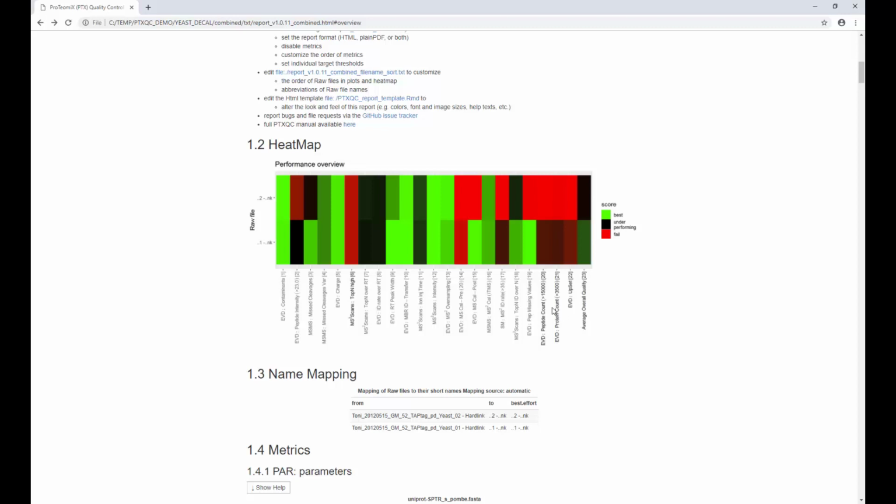Some of those metrics depend on magical thresholds. For example, we have a peptide count metric where we expect per raw file like 15,000 identified peptides after a false discovery rate. This very much depends on your setting, obviously, and in this case for the yeast data set this default might be a bit too high. That's why it doesn't really score very nicely. So you can change that and rerun the report. So that's the case here also for the protein count or for the expected peptide intensity.